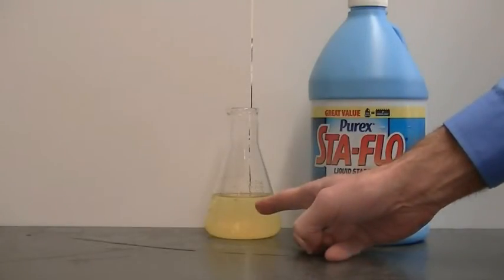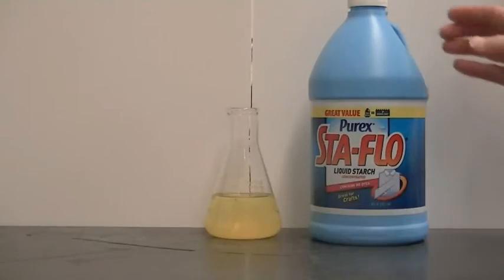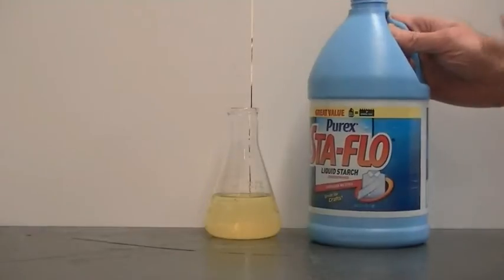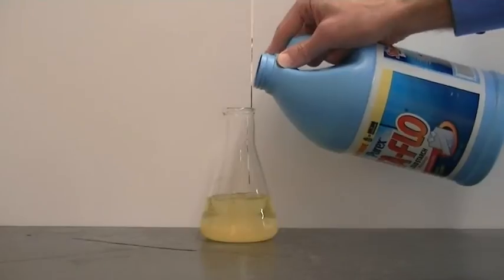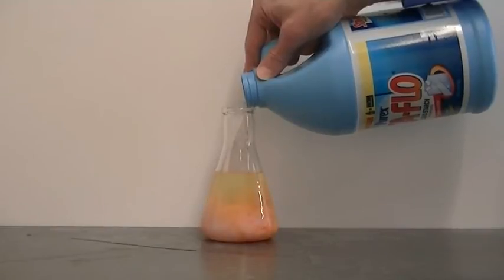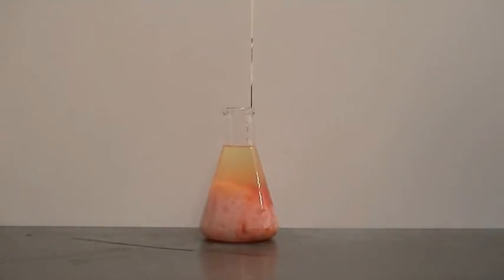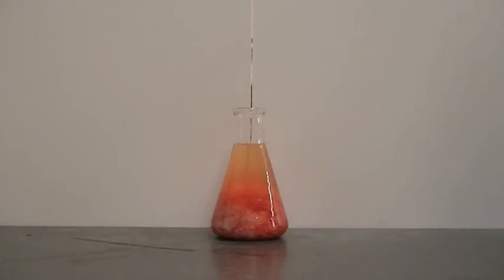Again there's some sunflower dye dissolved in acetone, and here I have some liquid starch that contains sodium tetraborate, which is a borate, so that should react with the curcumin dissolved in the acetone solution to form rosocyanin. Well sure enough, we get a red-colored mixture which indicates the presence of rosocyanin, and that further gives me confidence that the sunflower dye contains curcumin.